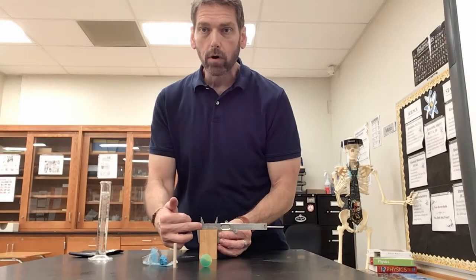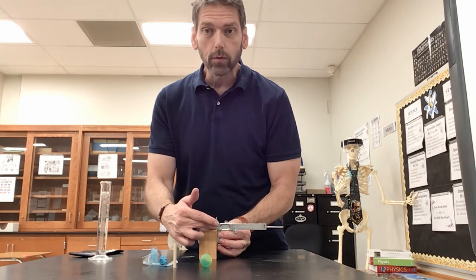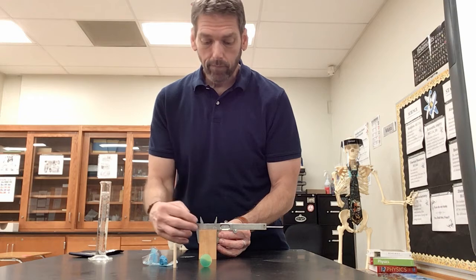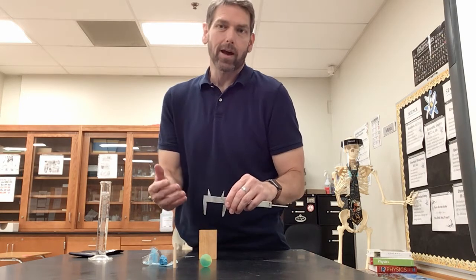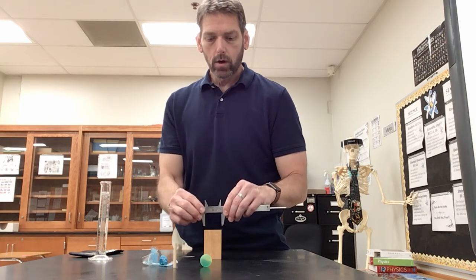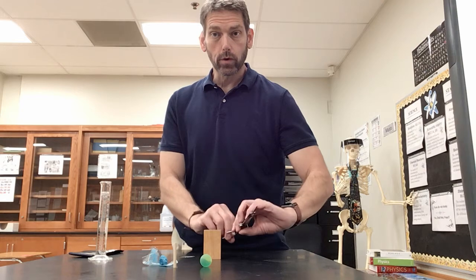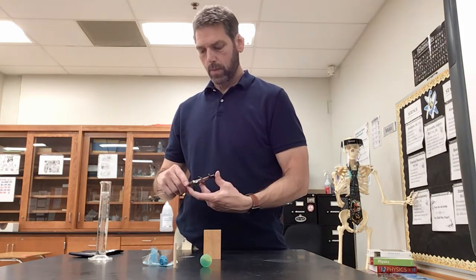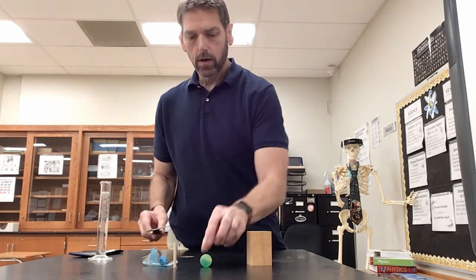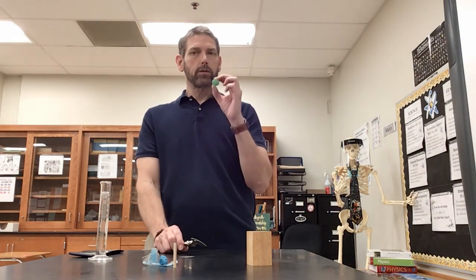There's a 0 mark, and you just move from where the 0 was over to where you see that right now. Okay? For something like this, of course, you would need length, width, and height. So you'd have to measure what you would call length, width, and height. You measure those three different dimensions, and you're good to go. For the spherical object, remember, there's a different equation.